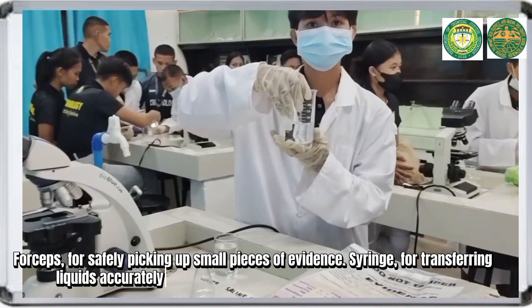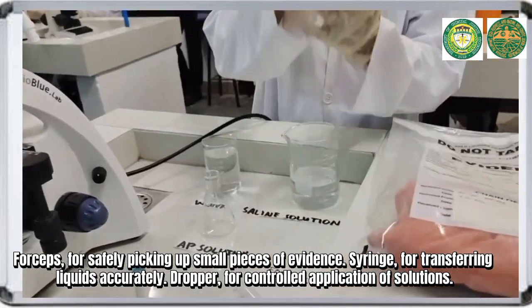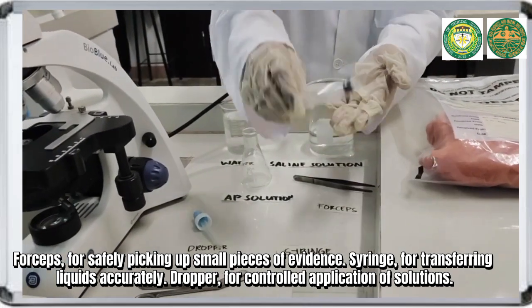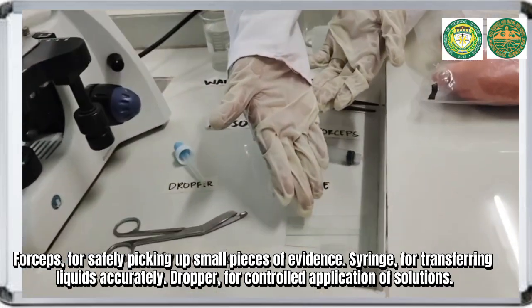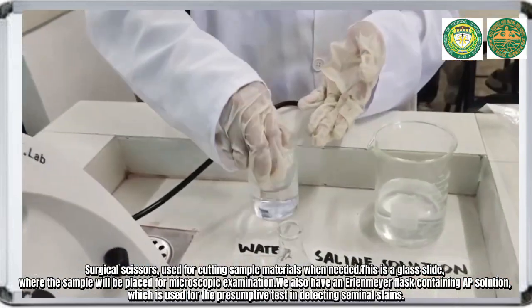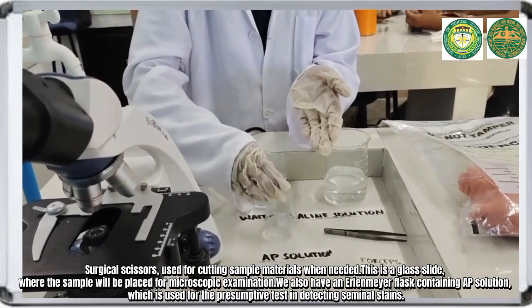Forceps, used for safely picking up small pieces of evidence. Syringe, used for transferring liquids accurately. Dropper, for controlled applications of solutions. Surgical scissors, used for cutting sample materials when needed. This is a glass slide, where the sample will be placed for microscopic examination.